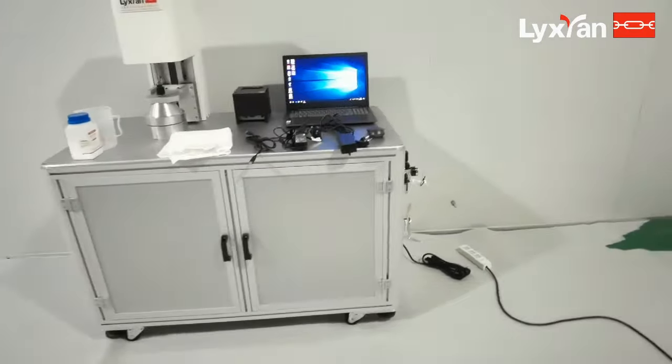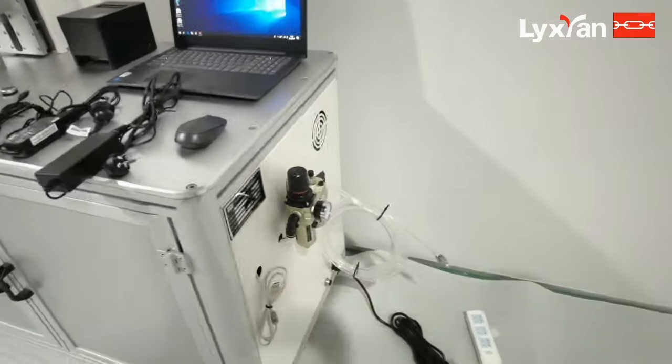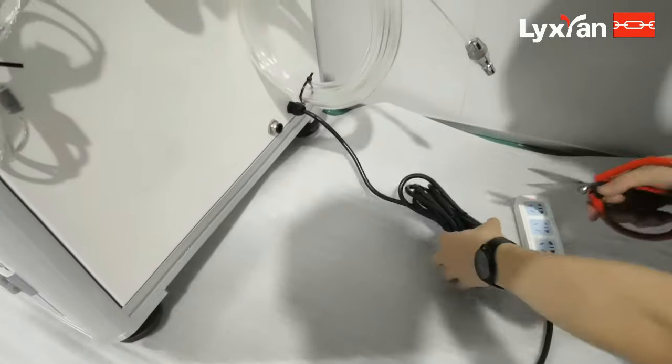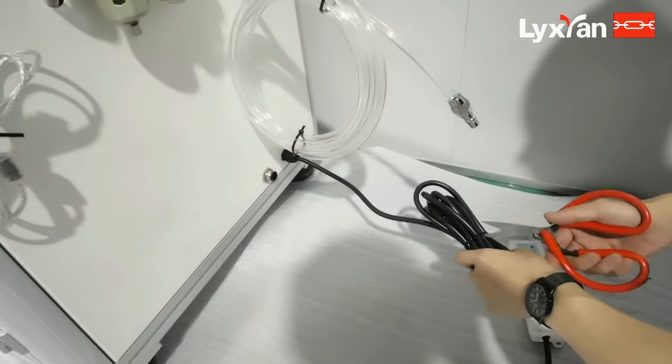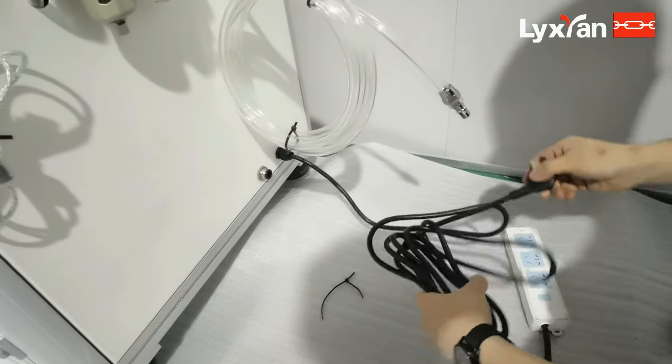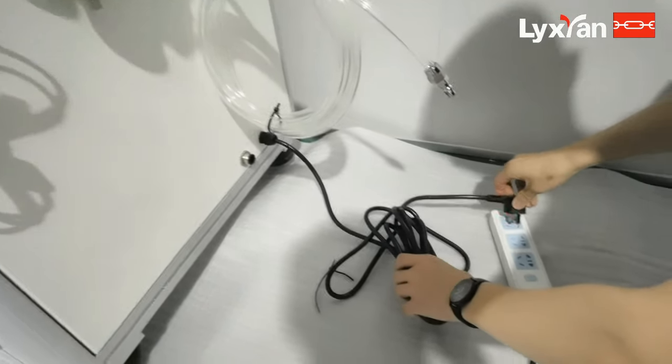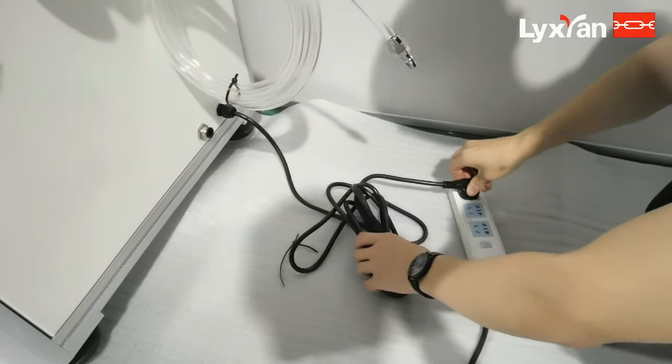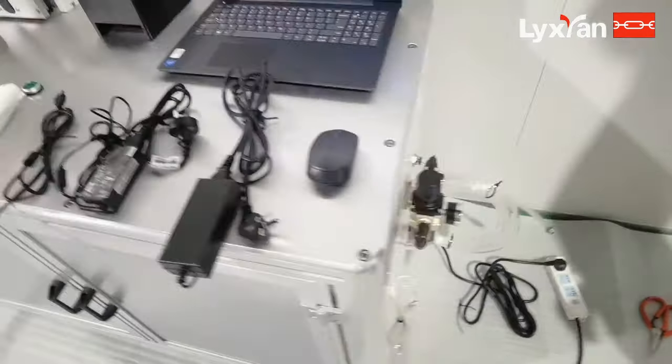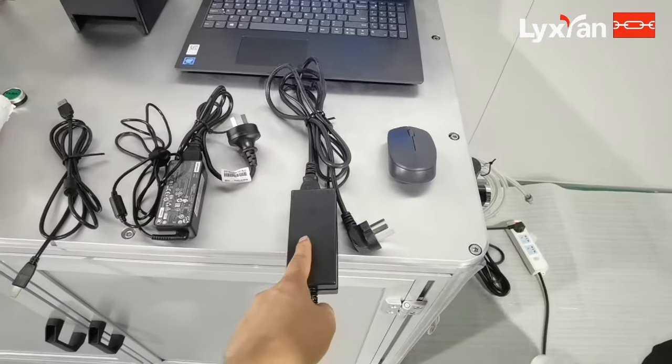Firstly, for the power, this main machine, and this one is for the printer.